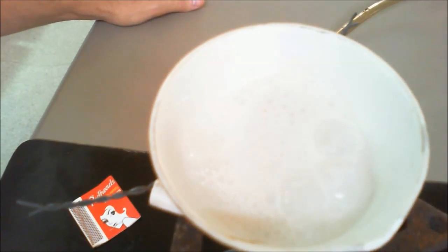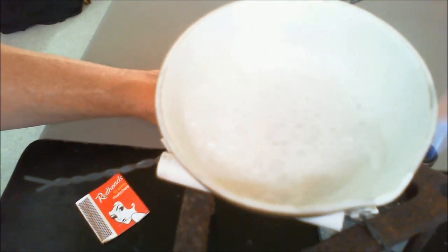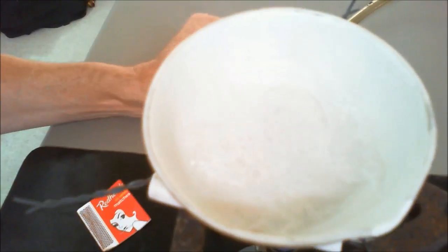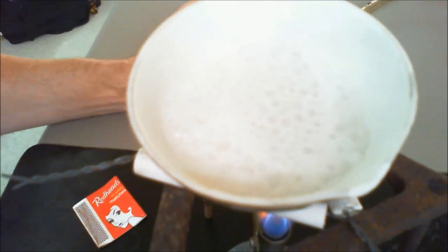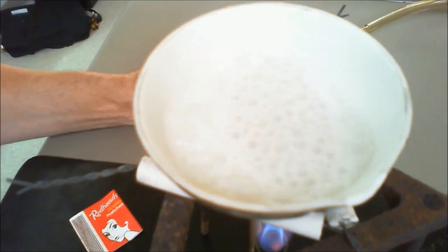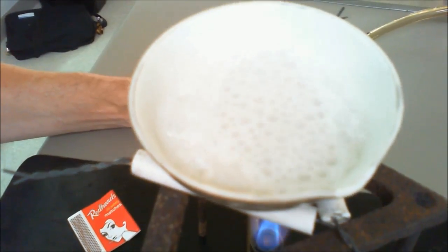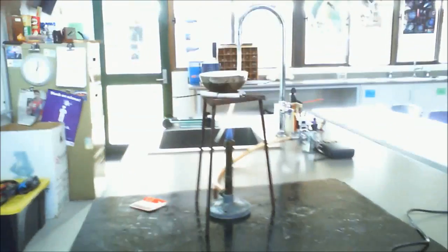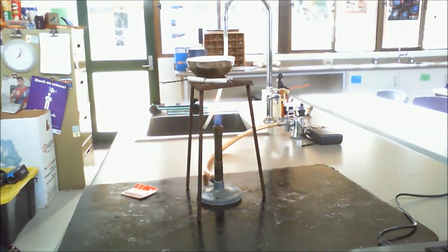Always important with this that if it starts to bubble over, that you can simply take it away, and that takes away the heat, and that helps to control the reaction. So again, we have more of that, and then obviously after a length of time we've evaporated one substance off. The question is, of course, what have we evaporated off? Now, a good idea with this practical is to remember what we made when we had an acid and a base, and could that basically work here. Okay, so what I'll do is I'll let that bubble for a little while, and then we'll come back to it, and we will continue on. So I'll just stop the video, wait for it to evaporate off, and then we're good to go.